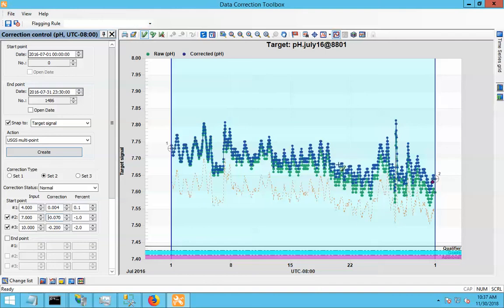And you can sort of see that in the chart here. These values that are a little bit higher and closer to 10, they're getting corrected a little more, and maybe these ones over here that are a little lower, they're getting corrected a little less because they're closer to 7 with a smaller corrective factor.